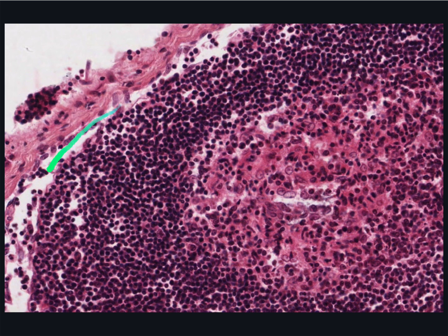Here is a germinal centre and the corona or mantle around it. Most of the cells in the corona are small lymphocytes. In contrast, many of the cells in the germinal centres of the nodules have large pale nuclei. This is why germinal centres stain palely.